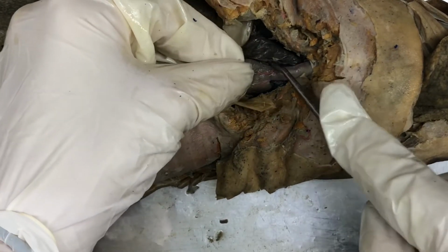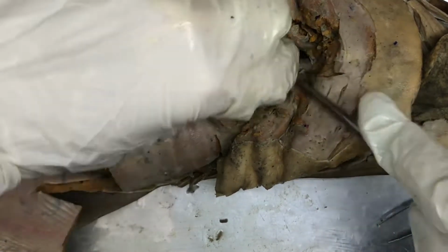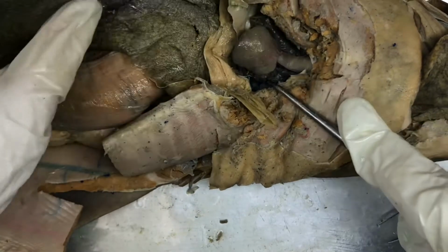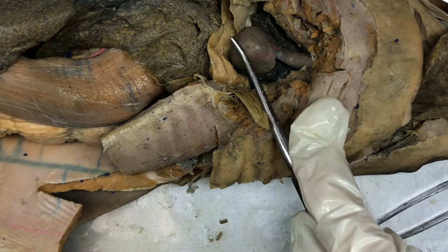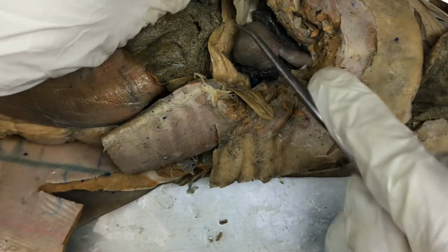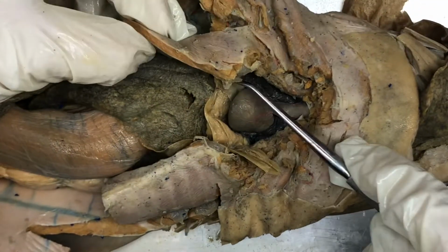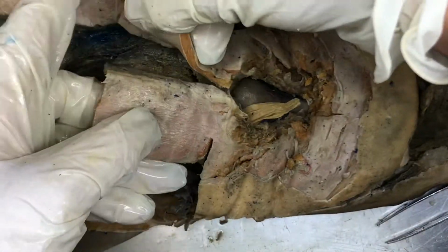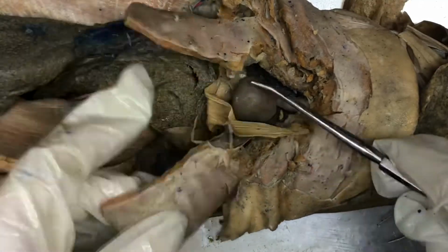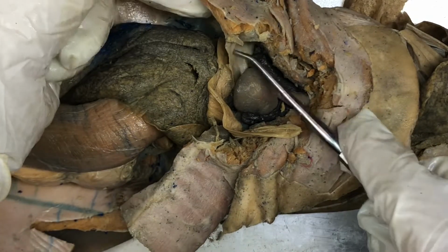The atria are on the sides right here and right here. And then we also have the ventricle, which is this big part right here. The transverse septum is what would be separating the heart from the rest of the body. So whenever you close this part right here, it would close it up. So the transverse septum is seen here.